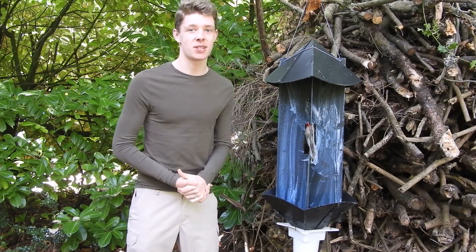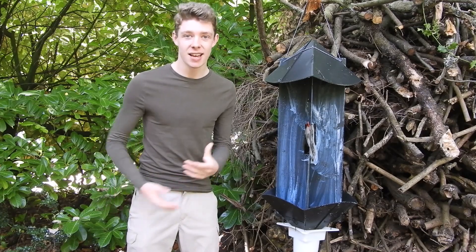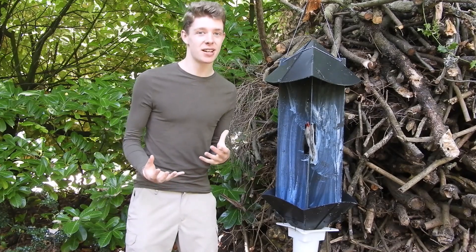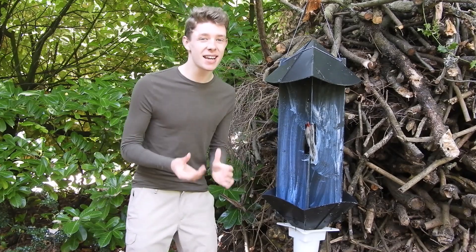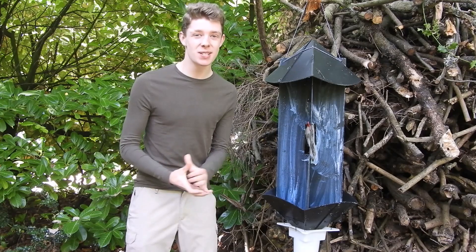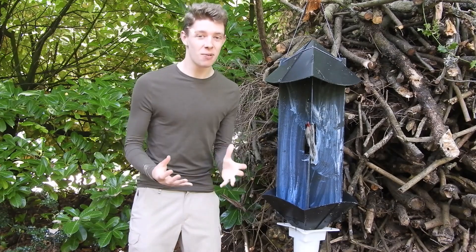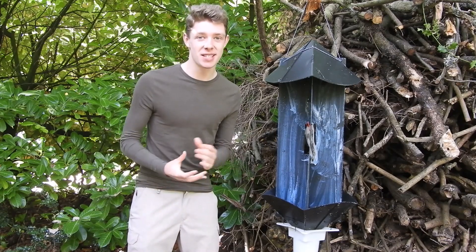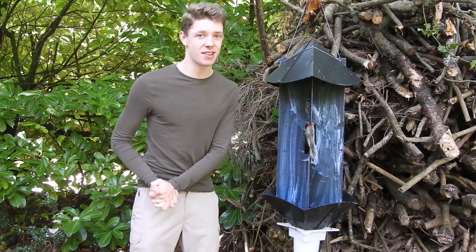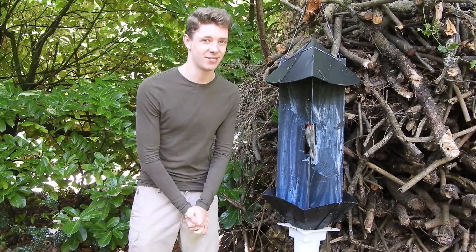Over the last few days my standout highlight was a Mymaridae — a fairyfly — except they're not actually flies but tiny parasitic wasps, which are the smallest flying insect known to mankind. This was the smallest insect I've ever identified, and I'm going to walk through how I did it.